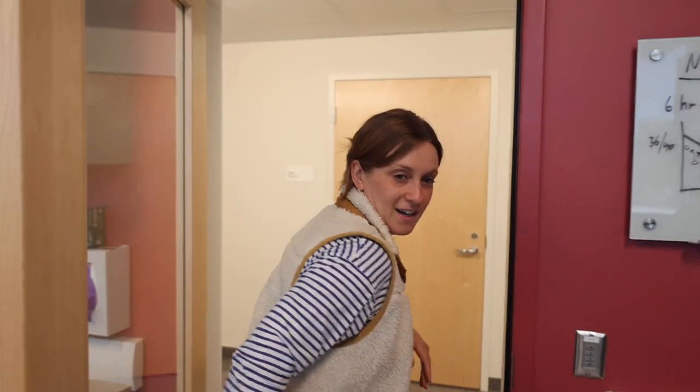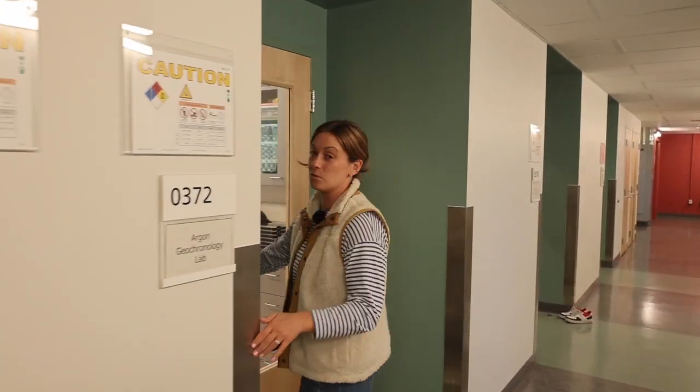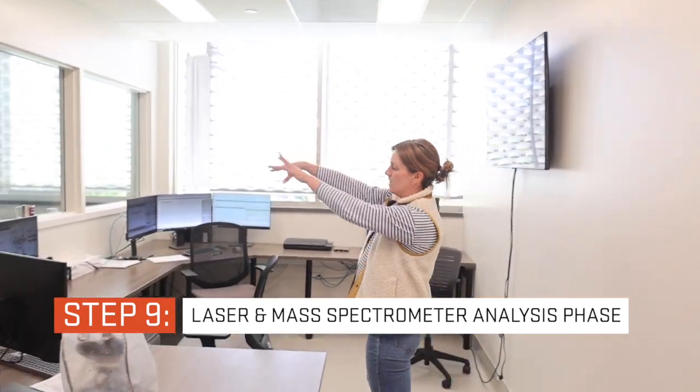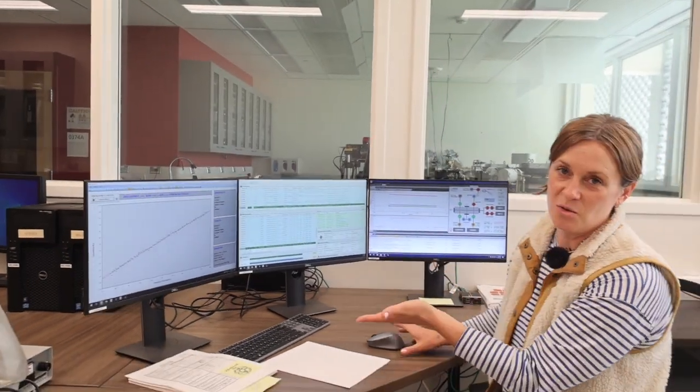Once they come back, we then move into our actual analysis phase. In the analysis, we sit down and our samples are loaded into the mass spectrometer, and we sit here and we're ready to analyze our sample.